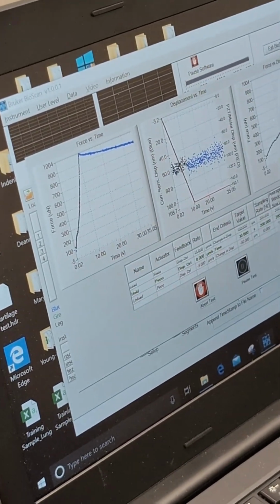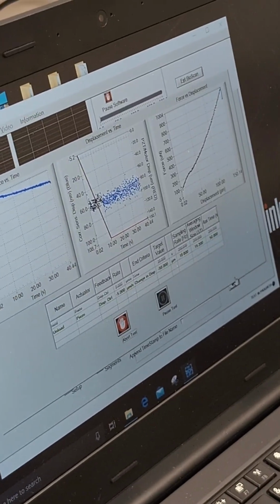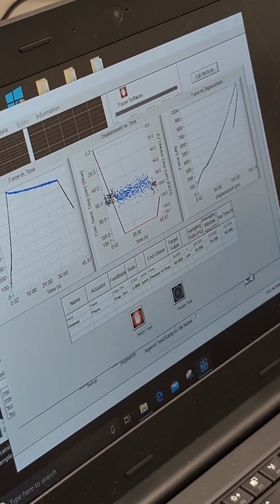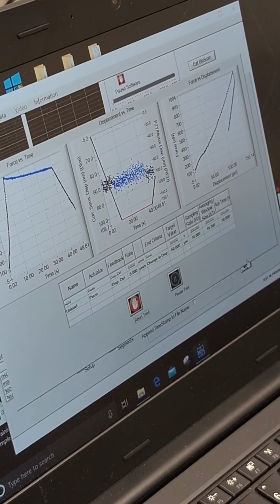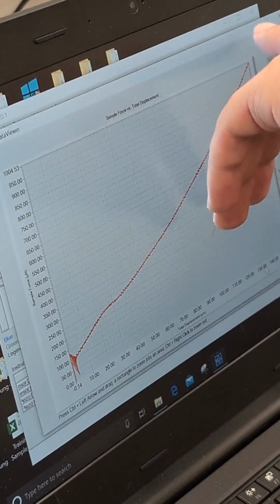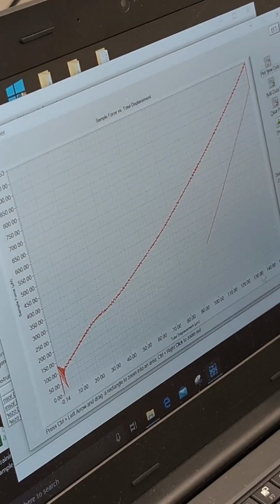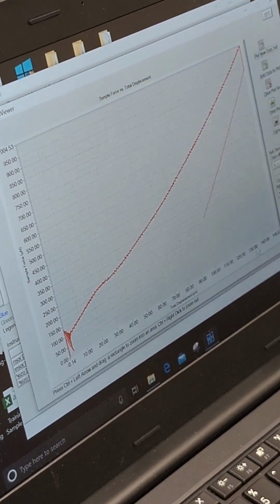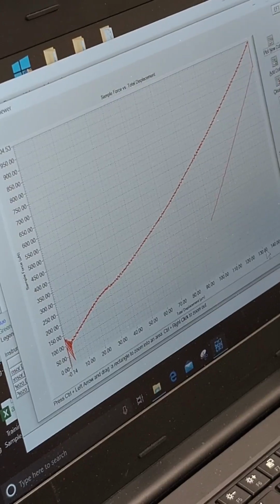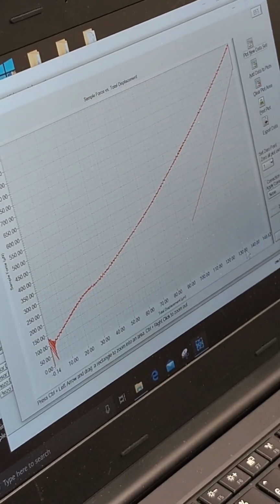That is essentially the force associated with a time. So this is essentially a function of time. You can see the curve going down is as straight as possible. It's, again, much easier to show you with the MATLAB data. With the MATLAB analysis, when you see how the curve fits, based on what I saw, you will probably get a pretty high R-square.